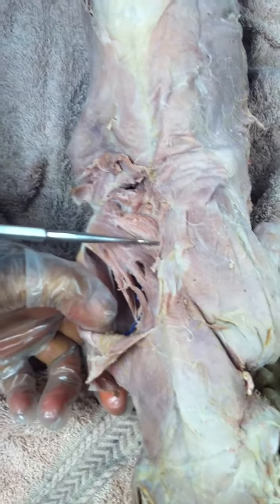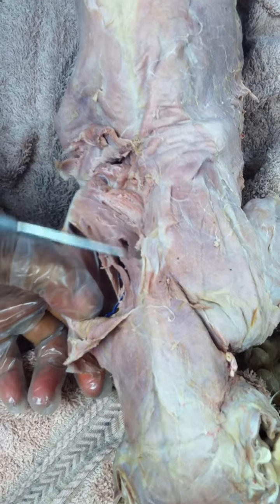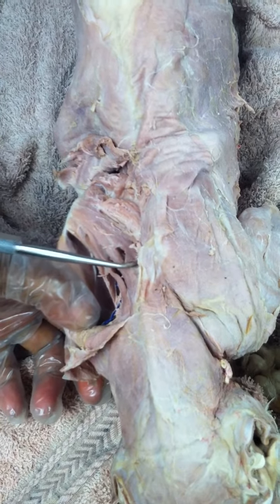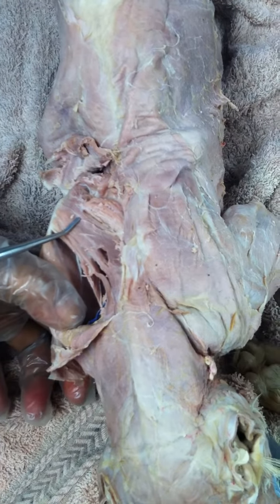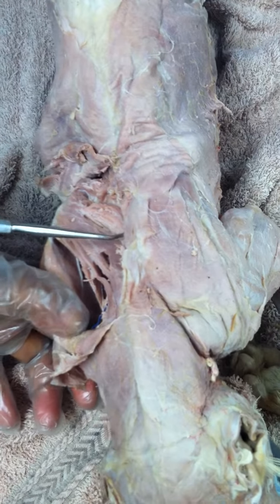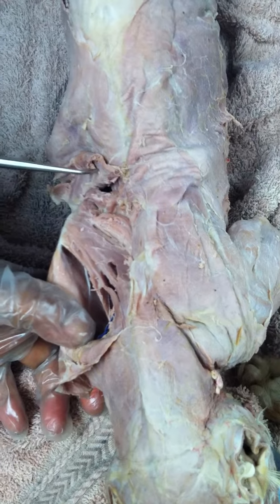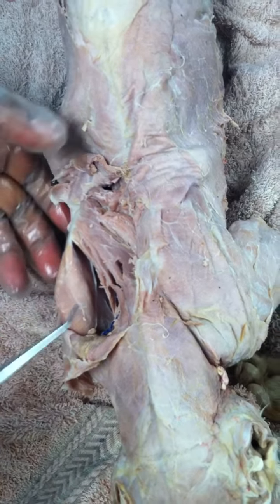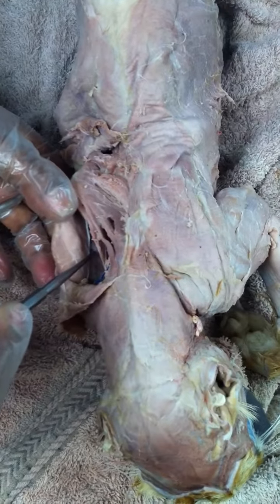And this is a bump that marks the end of the neck. So all above that, those are your neck's vertebrae. And these rhomboideus are known as rhomboideus cervicis or rhomboideus minor. Below that is your thoracic vertebrae, and those are your rhomboideus thoracis or rhomboideus major. Underneath the scapula, that's the subscapularis. Okay.